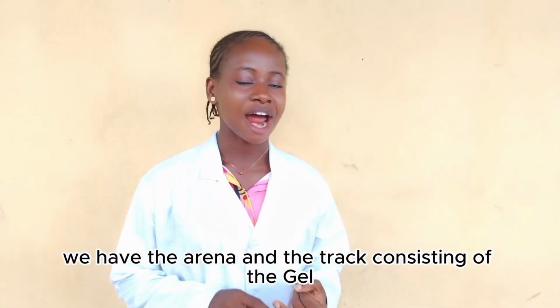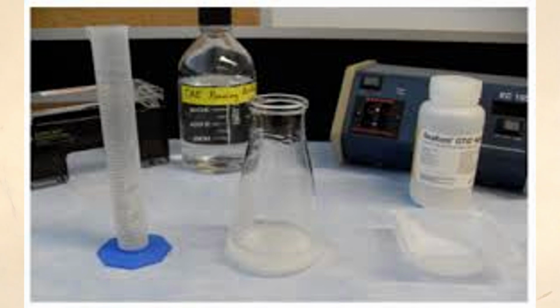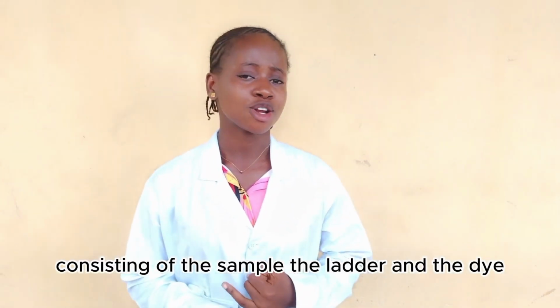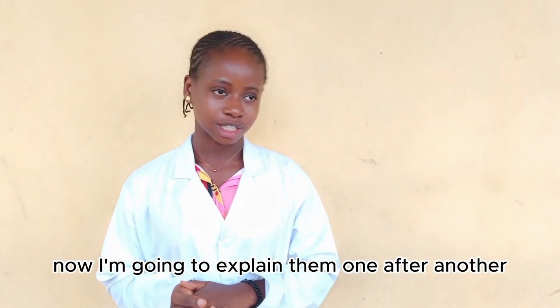The first group, we have the arena and the track, consisting of the gel, the buffer, and the chamber. The second group, we have the engine, consisting of the power supply. The third group, we have the runner and the camera, consisting of the sample, the ladder, and the dye. Now I'm going to explain them one after another.